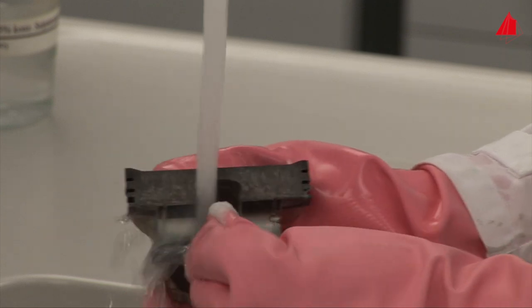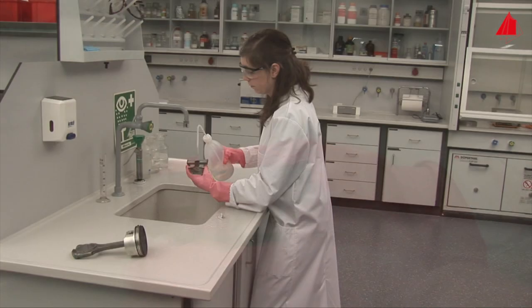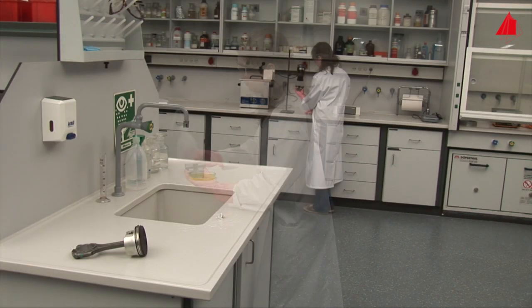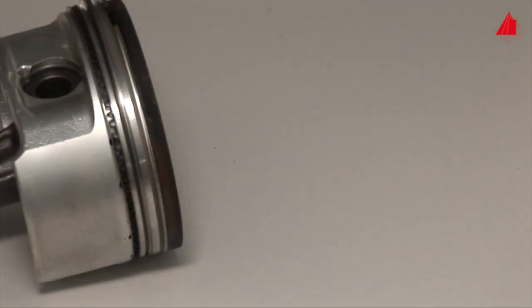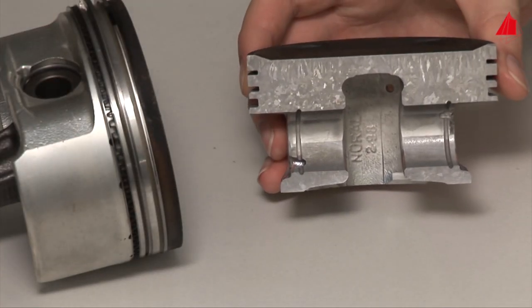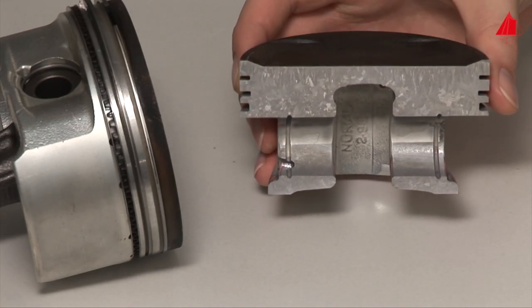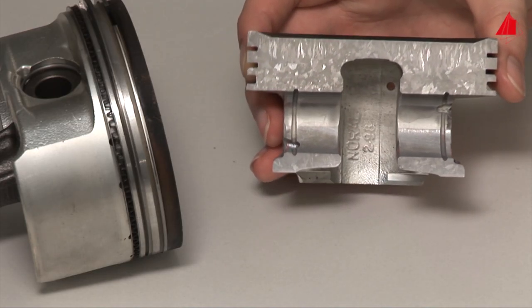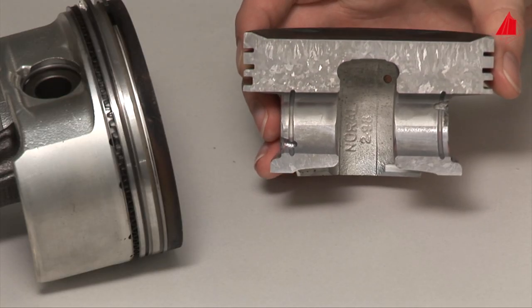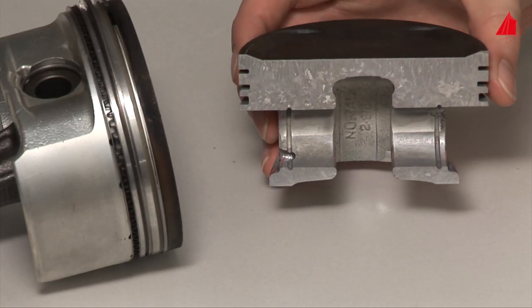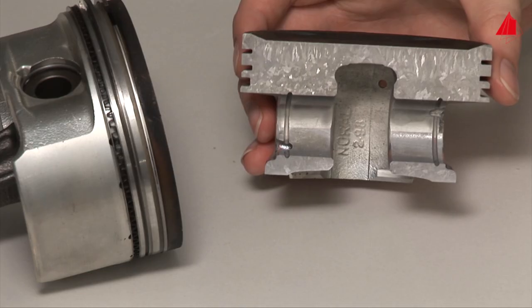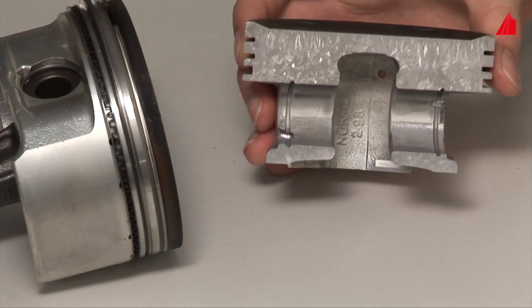After washing, cleaning and drying, fantastic crystals are visible again. It should not be concealed that these crystals, these grains, are not perfect and uniformly structured crystals, but so-called primary grains. Within the primary grains, many other very small crystals and also crystal defects may be found, but these can only be seen with appropriate microscopes.